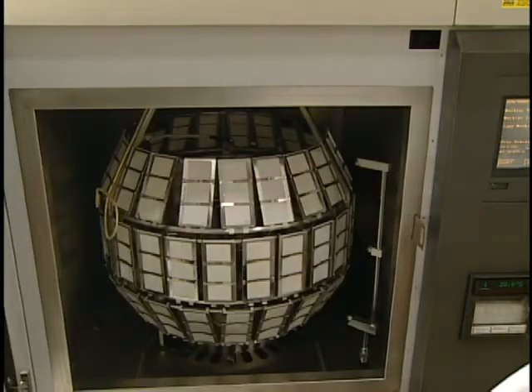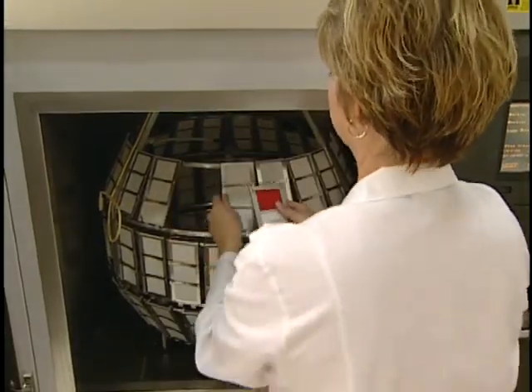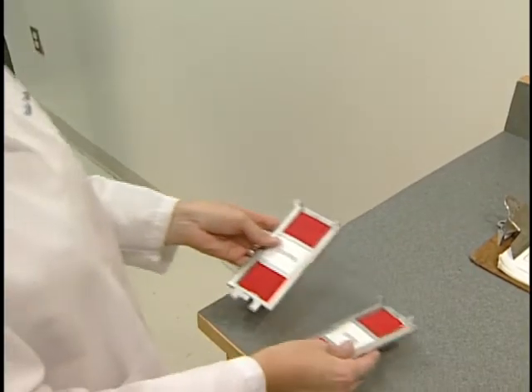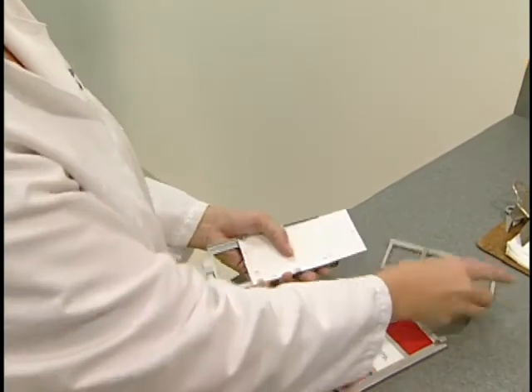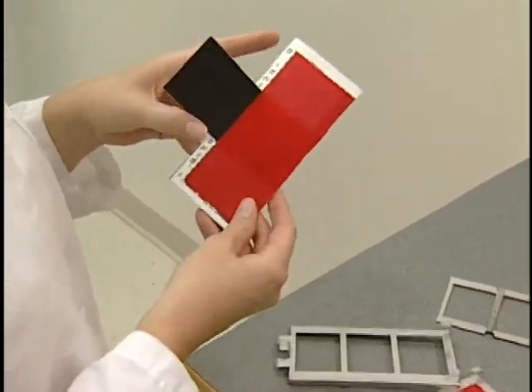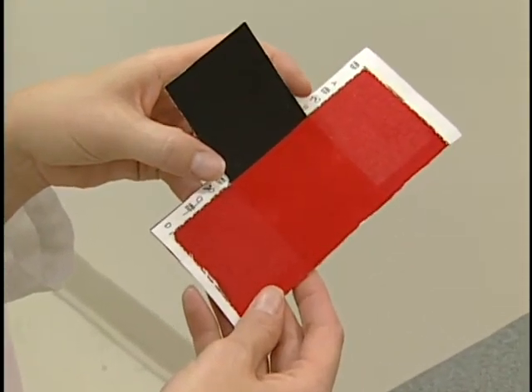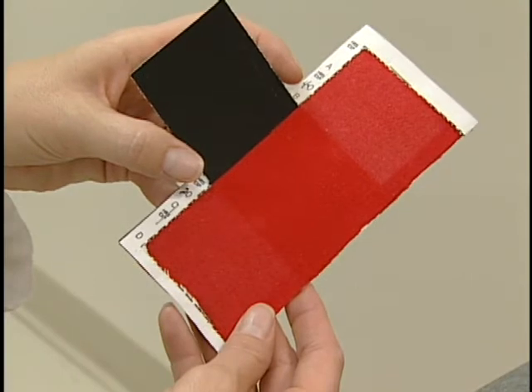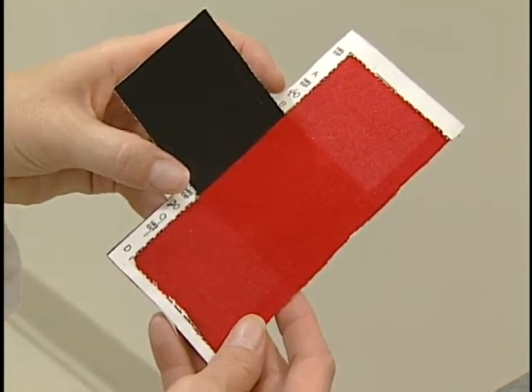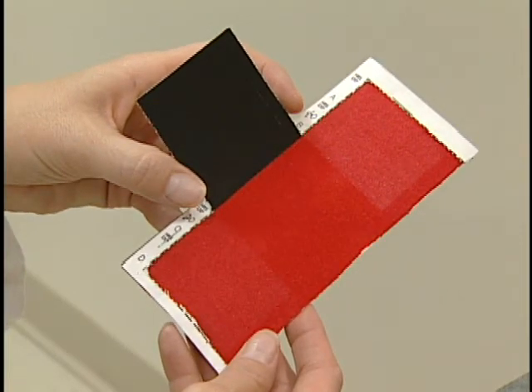After the weatherometer has completed the exposure cycle, the samples are removed for examination. In this case, two specimen holders are removed from the tester. The mounted lightfastness holders are removed from the mounting frame so that the specimens can be evaluated. The specimen holder has a middle portion that was not exposed to the light source. The bottom and top samples show the lightfastness fading for exposures of 20 hours and 40 hours respectively. It is obvious that this red shade has lightfastness issues.